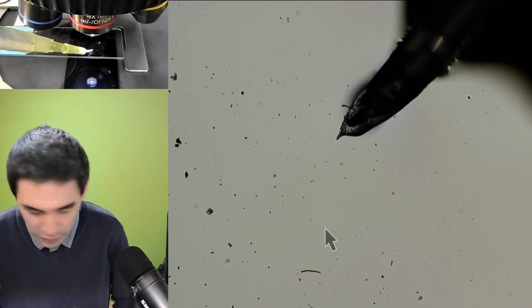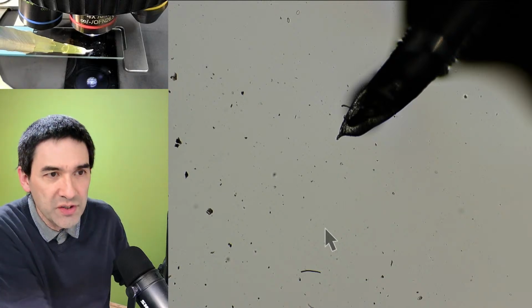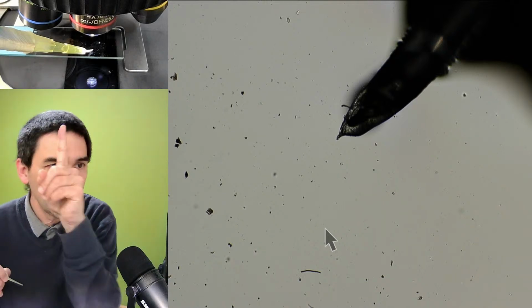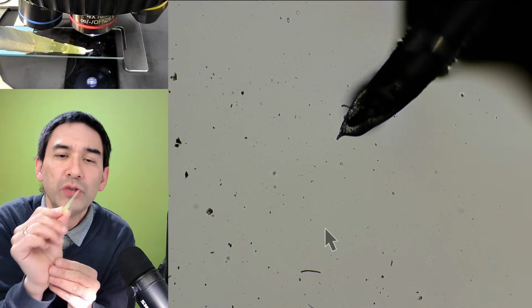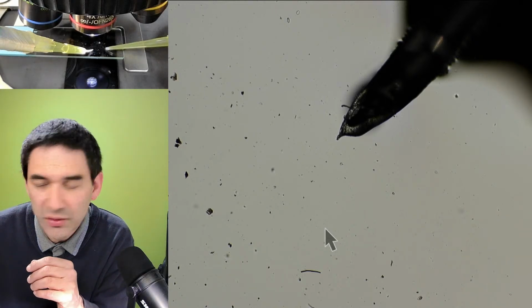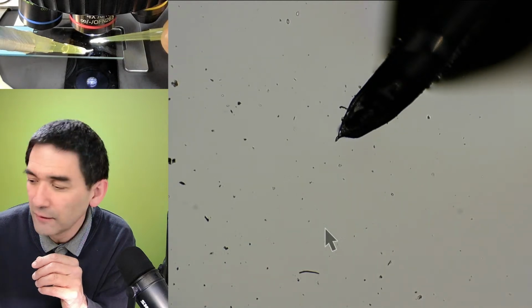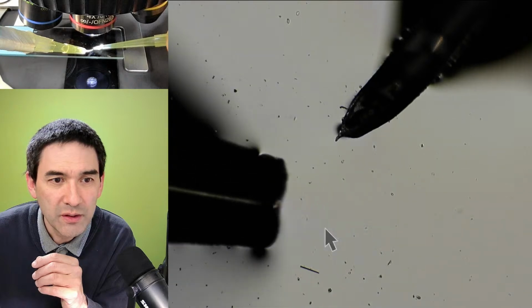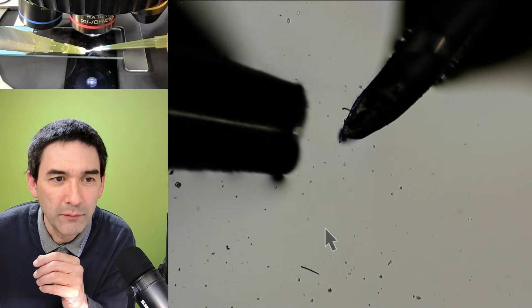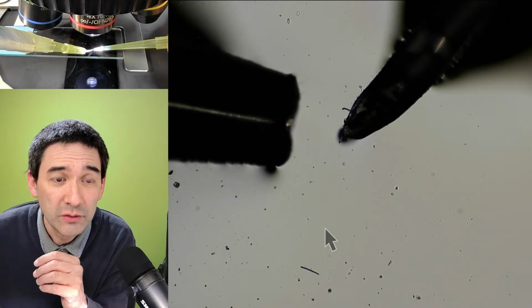In order to do that, I would like to simply show you a comparison now. So what you see over here is now the thin tip, okay? But I've got here now the original one, and I'm going to move it also into here so that you simply see the difference in diameter. You see? That is the tip of the original one, and you see that it's much thicker, right?